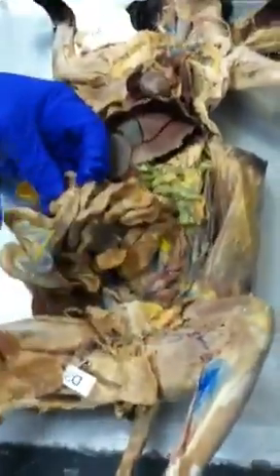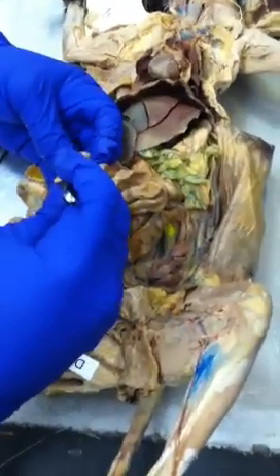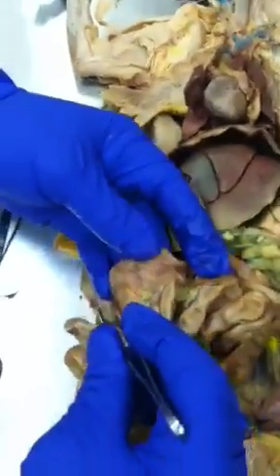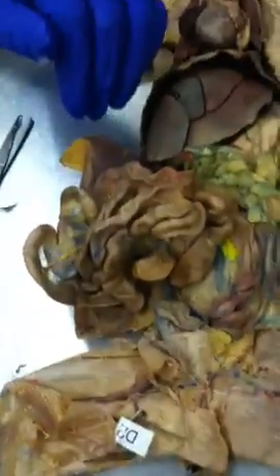Yeah. I said this is the ileocecal junction here. You have the ileum and the ceca. The ceca will be here. This one doesn't have the appendix, you notice, because it's a cat; the appendix is in the human. And you see how the large intestine is just smooth? It doesn't have the haustra, those little baggy things in the human colon.